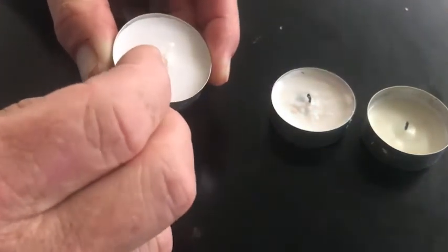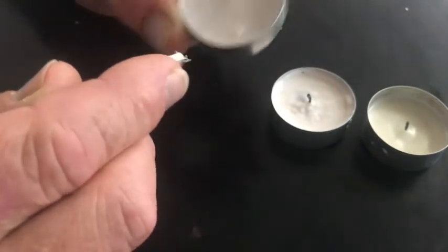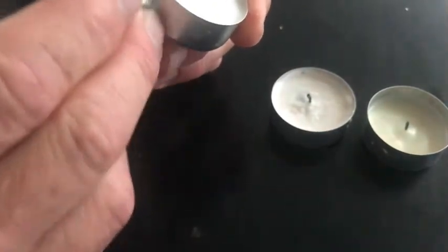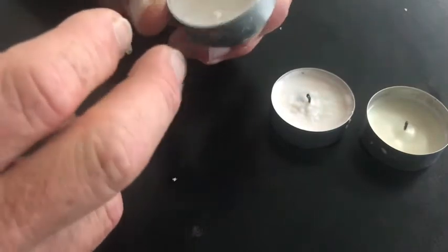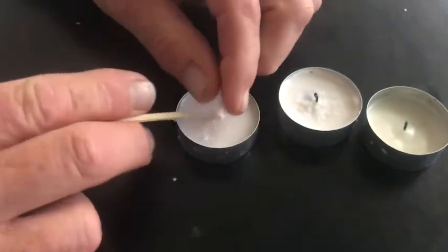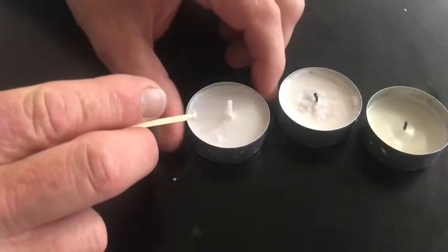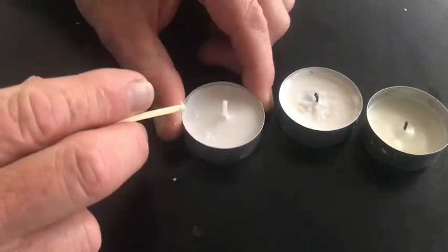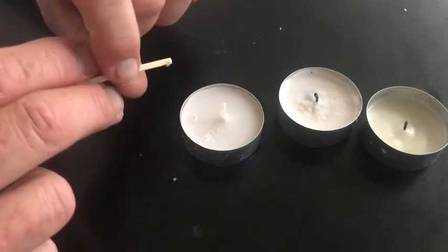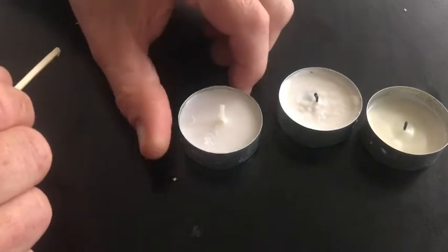I have this soft wax, right? So I can draw on it. It's pretty soft as compared to the metal on the outside. This is its container. So I have a container, a whole bunch of metal, and then this piece of cotton sticking up from the middle is called the wick, and it's a piece of cotton and it has wax coating it. So those are the components of the candle.